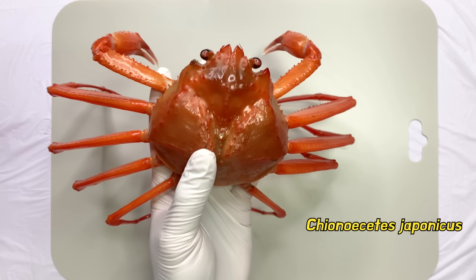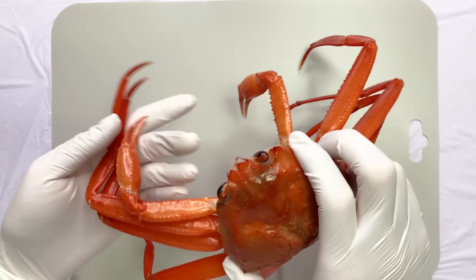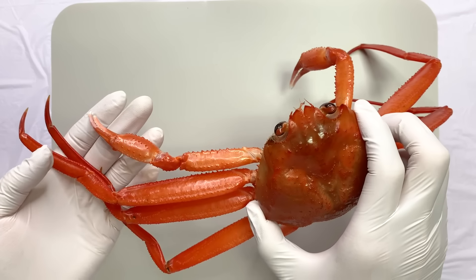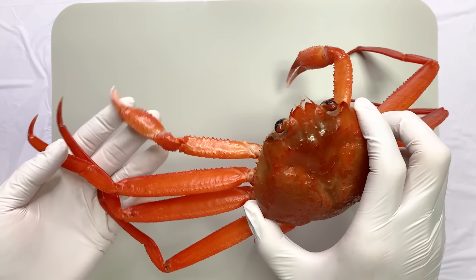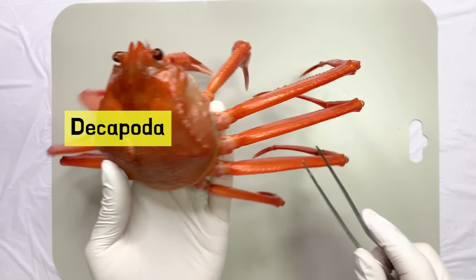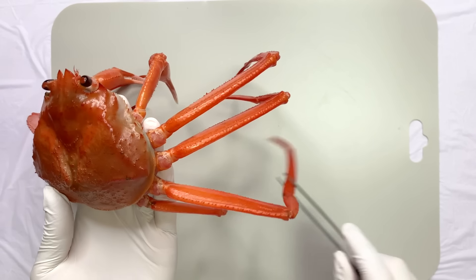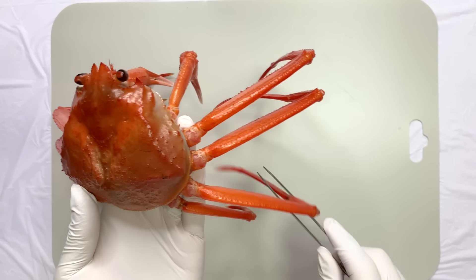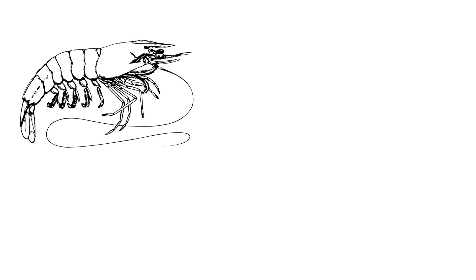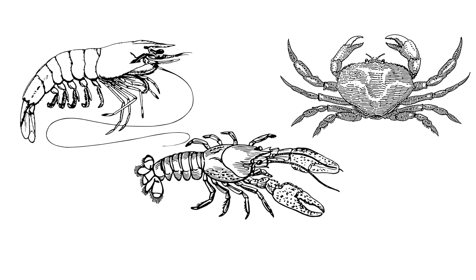This is the crab we will observe today. Crabs are arthropods with segmented bodies and jointed limbs. They belong to the decapod group, which has 10 legs. Decapods include shrimp, lobsters, and crabs.